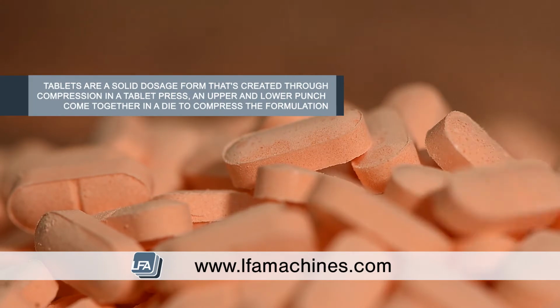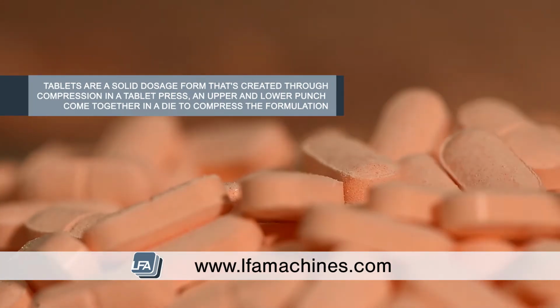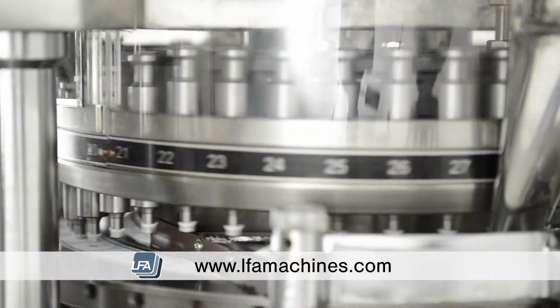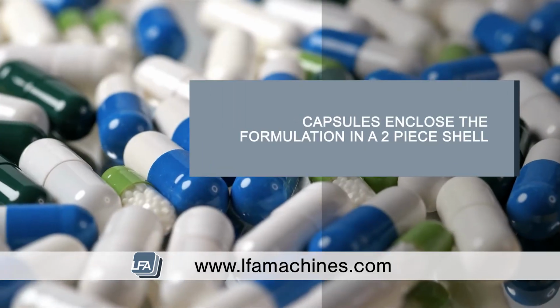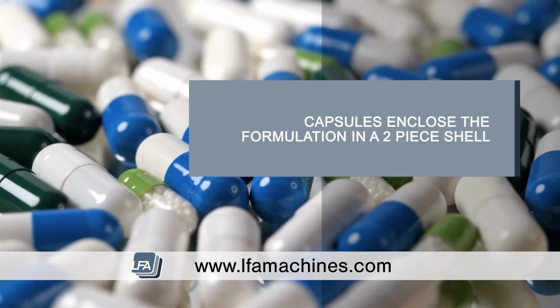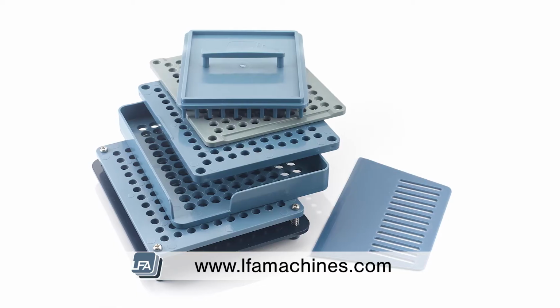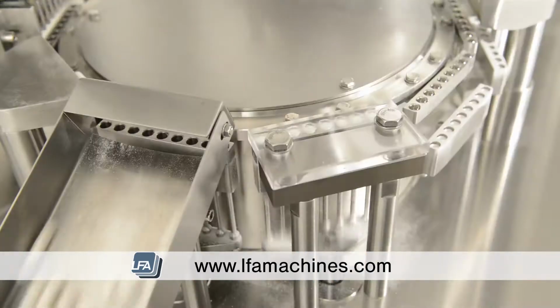Tablets are a solid dosage form created by compression of powders in a tablet press. There are several types of tablet presses, from handheld, desktop, or rotary tablet presses that will all produce tablets. Encapsulation uses two-piece hard-shell capsules to enclose the excipients and API of your product. There are a range of capsule fillers including handheld, desktop, semi-automatic and fully automatic.